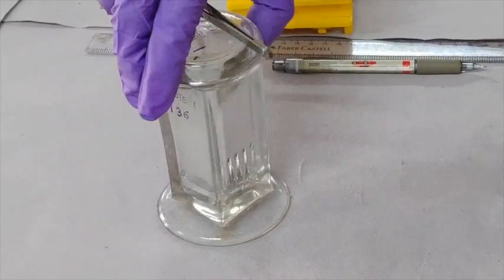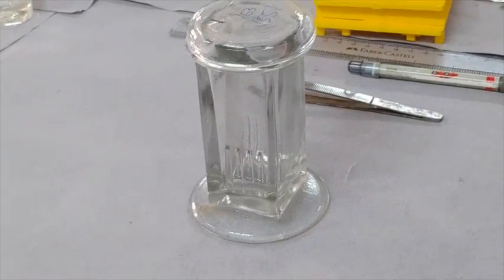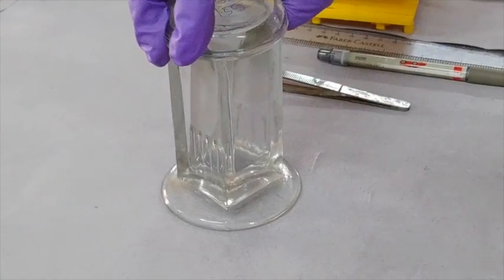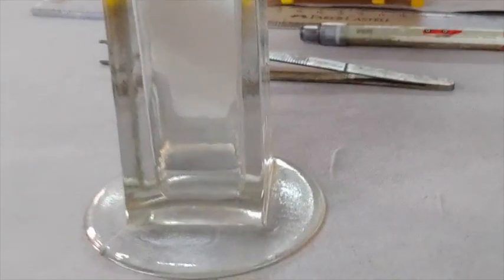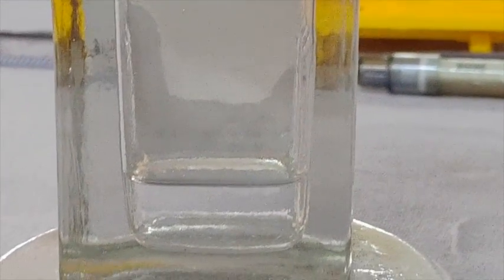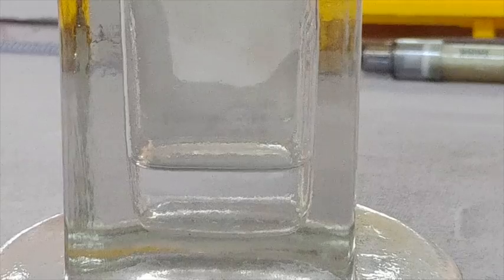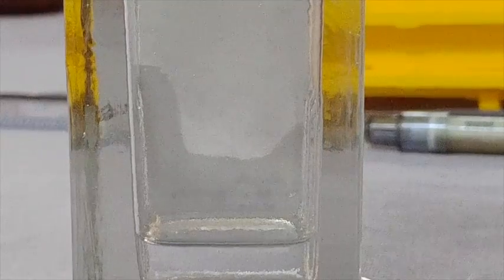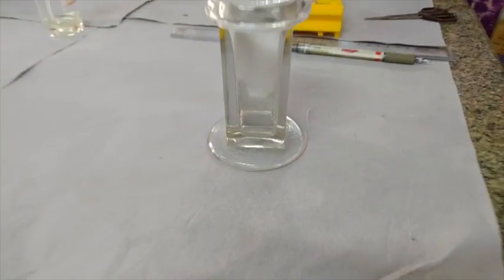While placing the plate in the chamber, make sure the solvent is not above the line drawn for loading the samples, because this will make your sample solubilized in the solvent mixture. The solvent will be taken up the paper by capillary action. Leave the chamber undisturbed for the amino acids to separate.